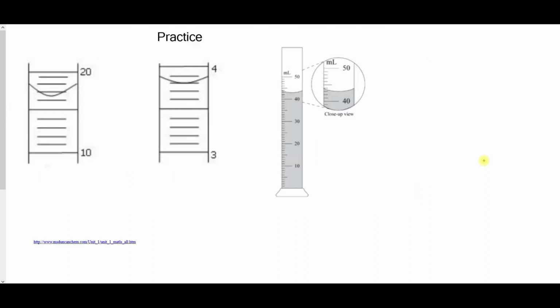Please pause the video and try these. If we look at the first one, we know that in the tens place, it is 10. Each marking, 3, 4, 5, 6, 7, 8, 9, 10. So each marking is in the ones place, and we know it's at the 6. And then we're going to estimate in between here, and I would say that is halfway, so I would put it at 0.5 milliliters.